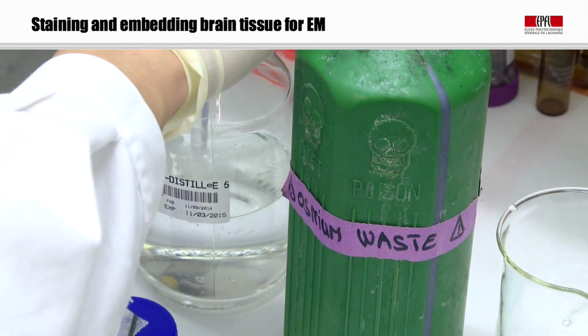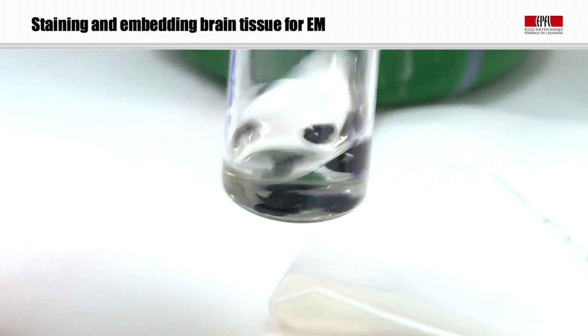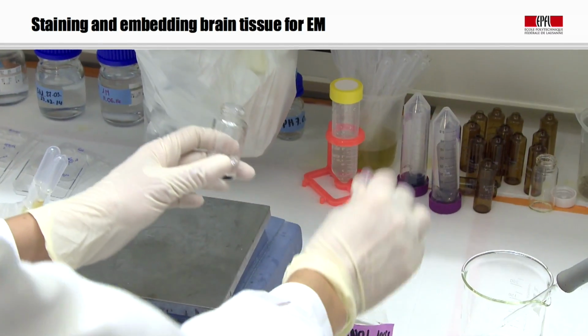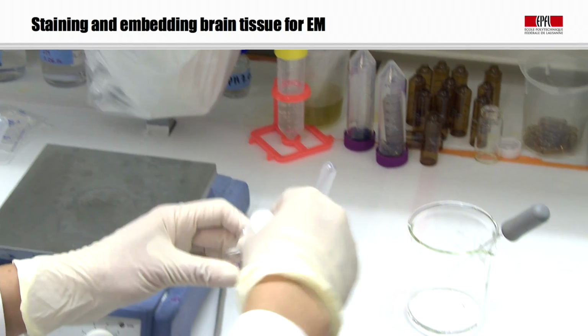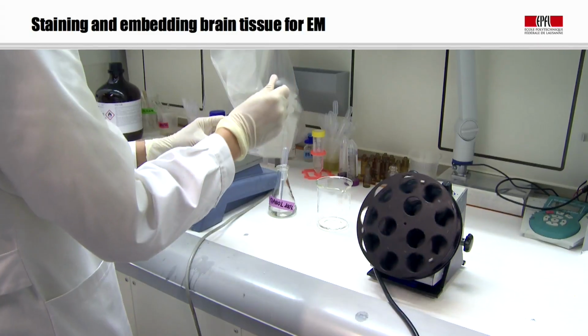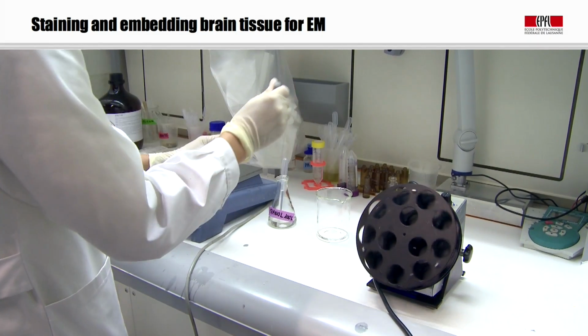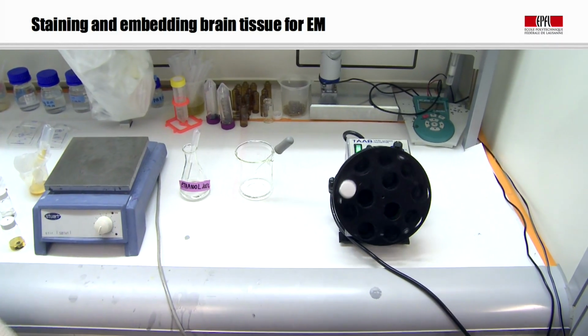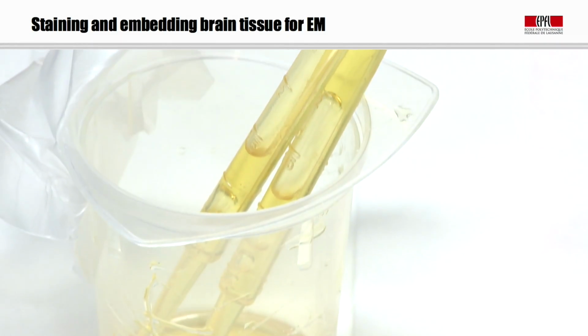And introducing these heavy metals gives us these very, very densely stained sections. So they typically become black, very, very opaque. There's then a process of removing the water, so we dehydrate the sections through a series of increasing concentrations of ethanol. And then once we're in 100% ethanol, we can then start to introduce a resin.